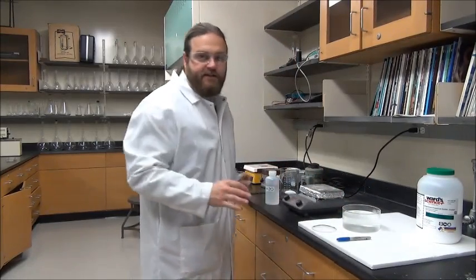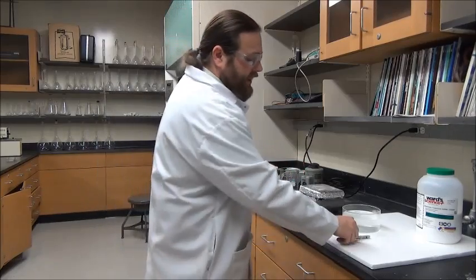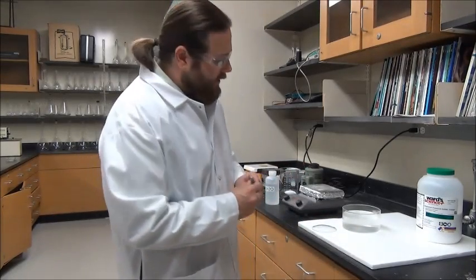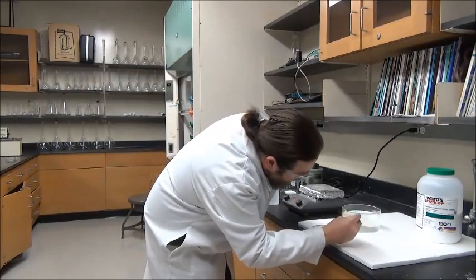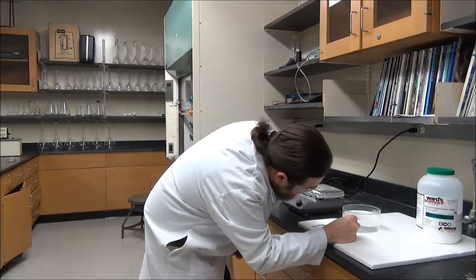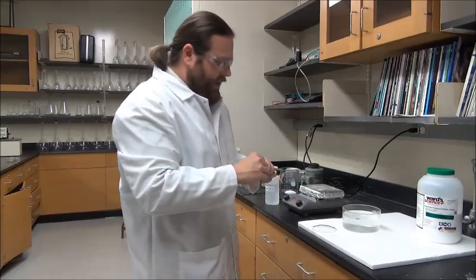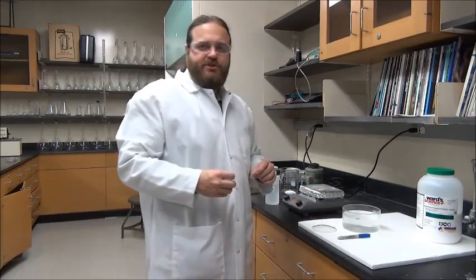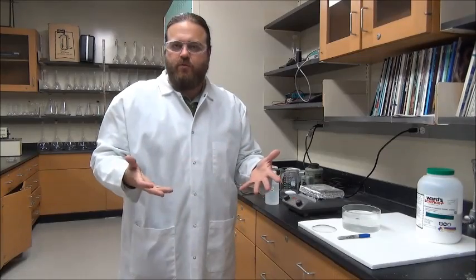One thing I like to do when I'm setting these up is to really have a handle on how much water is present. I like to take a marker and make a line right at the water level here. So as this dish sits, water is going to evaporate, and once we really hit that solubility point, crystallization will begin.